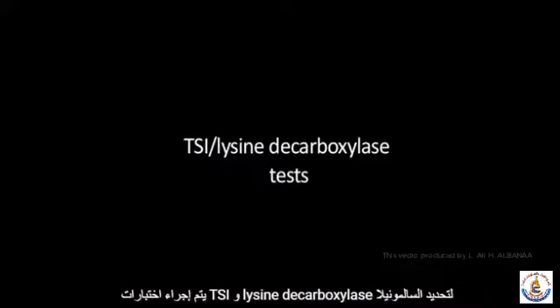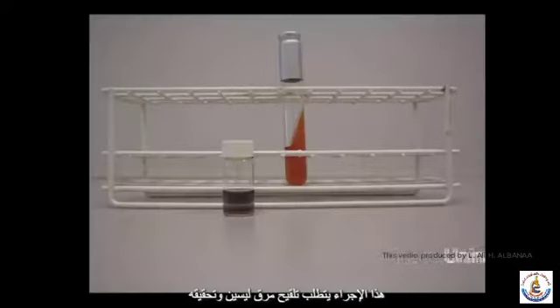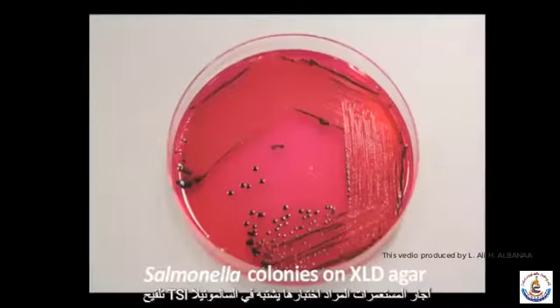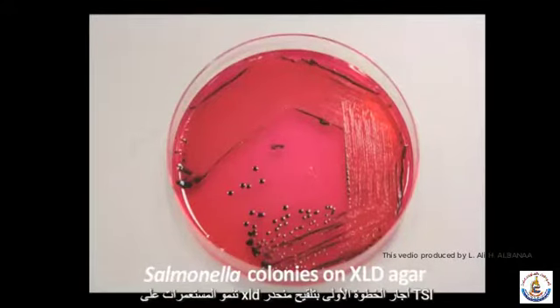The TSI and lysine decarboxylase tests. These are done to identify Salmonella species. This procedure requires uninoculated lysine broth and a tube of uninoculated TSI agar. The colonies to be tested are suspect Salmonella colonies growing on XLD agar. Step 1. Inoculation of the TSI slant.